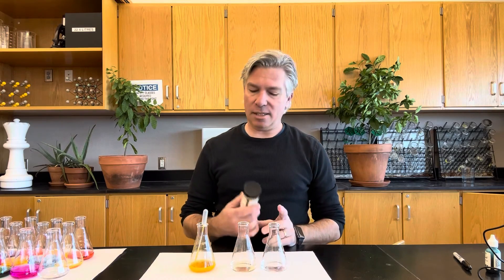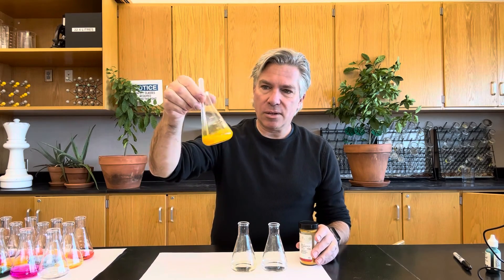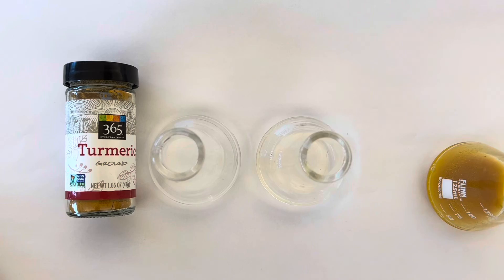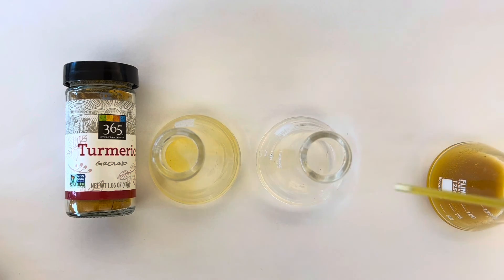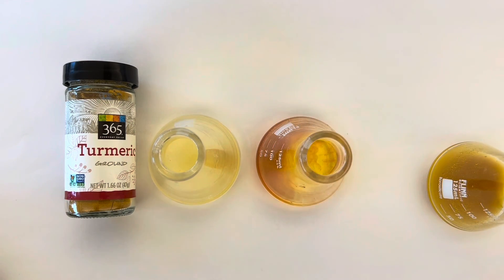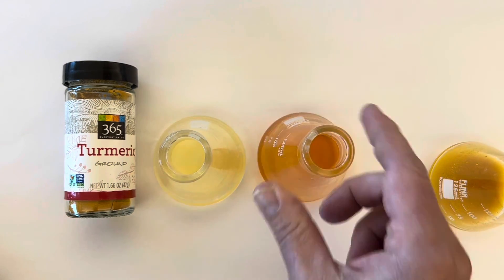And now for one more very special acid-base indicator: turmeric. I raided my spice drawer and got a little turmeric, put it into a flask with some water and a little bit of alcohol to help it dissolve. Here it is in acid solution — dilute hydrochloric acid — and some dilute sodium hydroxide. You can see a definite color change between the two: a nice light yellow in acid and a nice bright orange in base. So literally, when you see that color change happening, you're seeing evidence of electrons shifting inside the molecule and reflecting different colors. If that doesn't improve your day, I don't know what will.